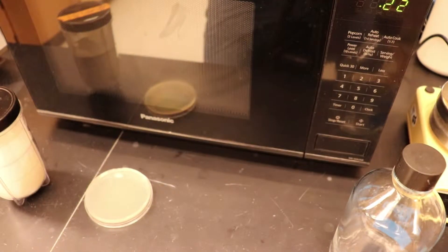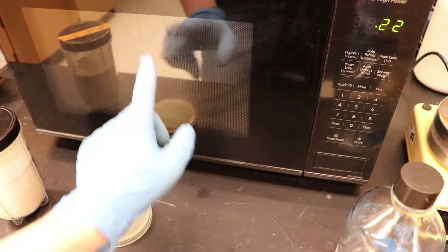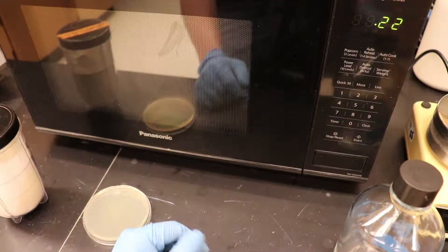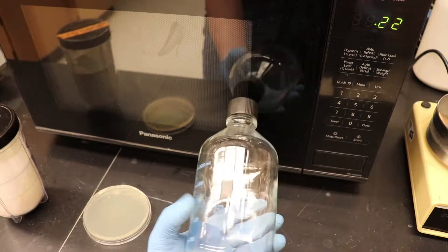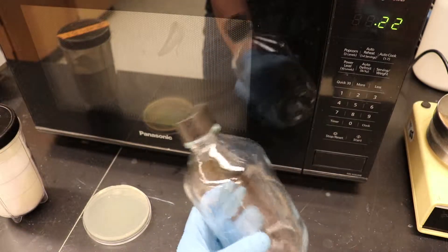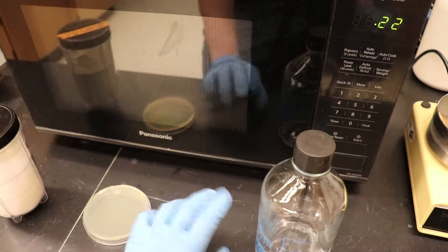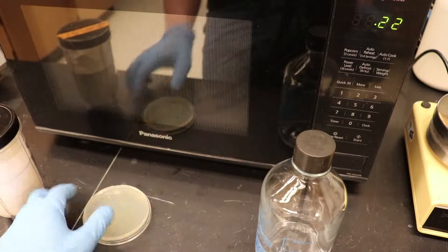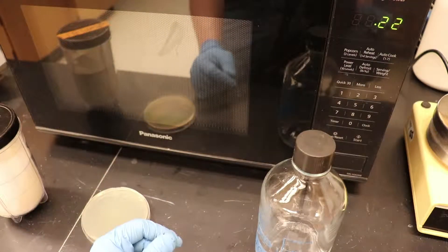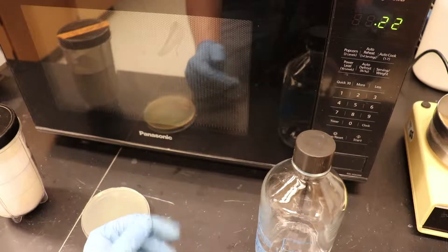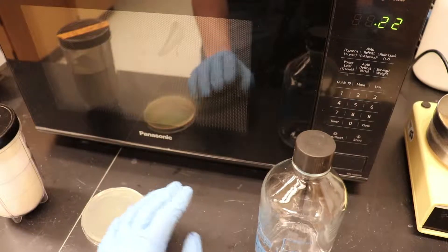Well, the answer is right here in front of us. It's this magic invention known as the microwave. And some people may frown on this trick. They may say that it's not sterile or the quote-unquote proper way to do things. But, it saved my bacon many, many times. And the plates that you can make in a microwave are comparable in quality and what you can get from an autoclave. And they last more than long enough for you to get the results that you need.